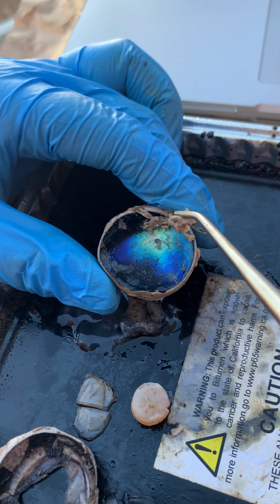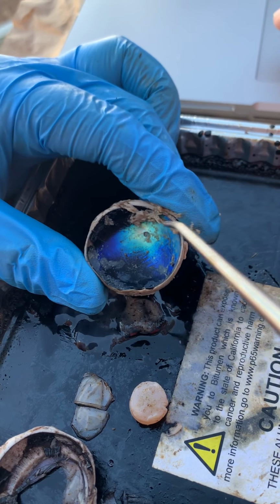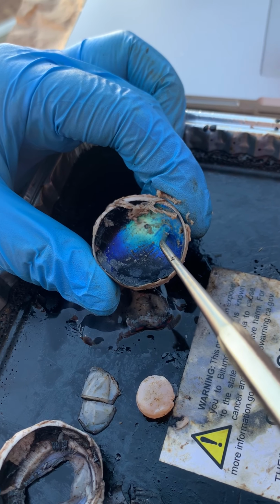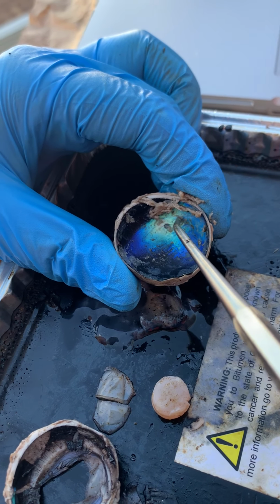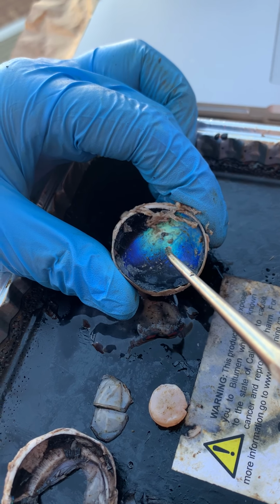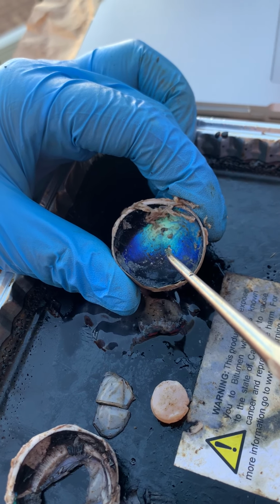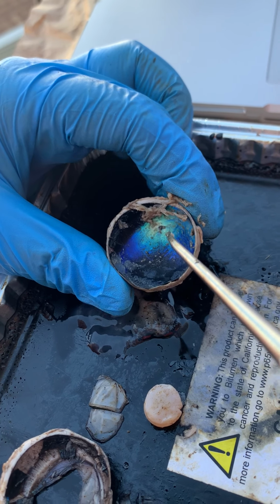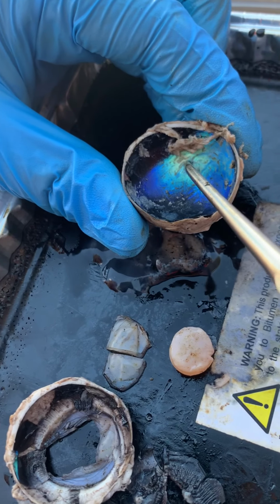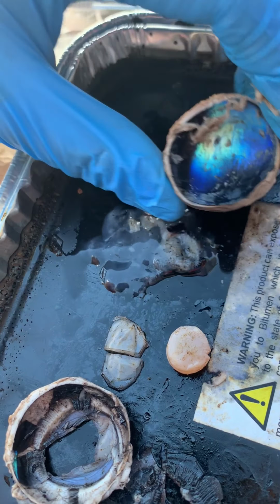The tapetum lucidum is the colorful portion of the back of the eye, and it functions to allow for seeing light in low light situations and helps with night vision. This is also the reason why we see glare in the eyes of animals when we take pictures of them at night. When the retina converges to meet with the optic nerve, a blind spot is formed, and we can see that dot right there is the blind spot.